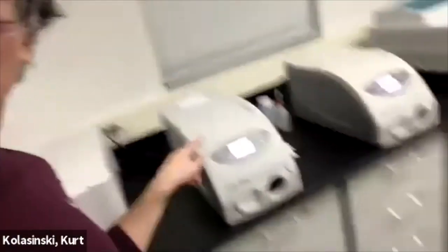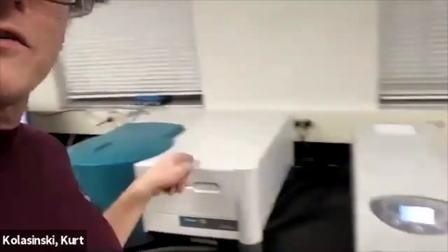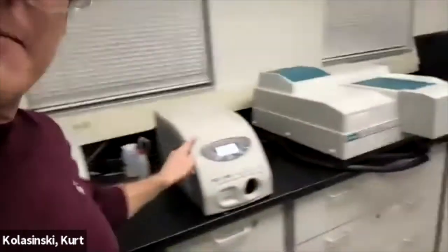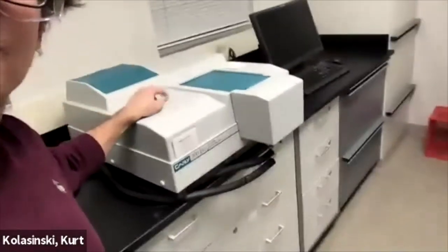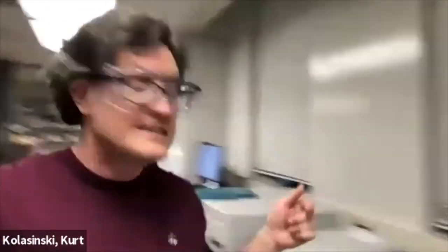Oh, let me give you a little secret. We've got the temperature controller for the fluorescence machine. There's also a temperature controller for the UV vis. If nobody's in here and you need to control the temperature, put the sample you're about to measure in the fluorescence. And the next one you're going to measure, put it in the UV vis and get it down the temperature where you want it to be. And it won't take as long.